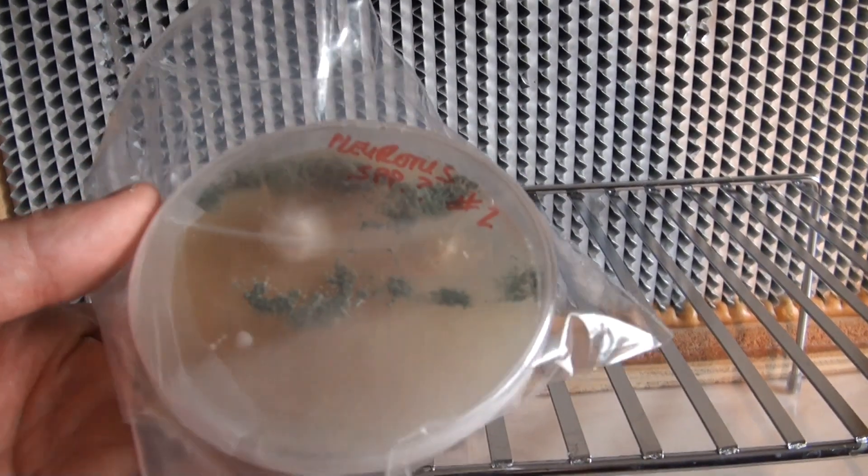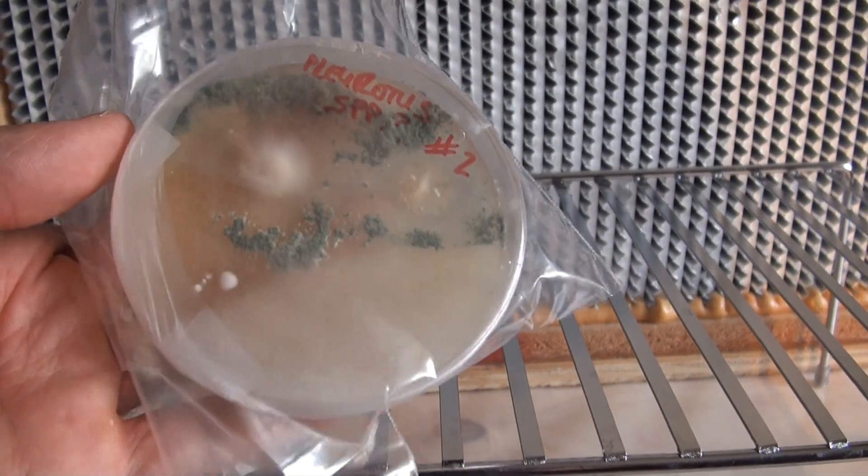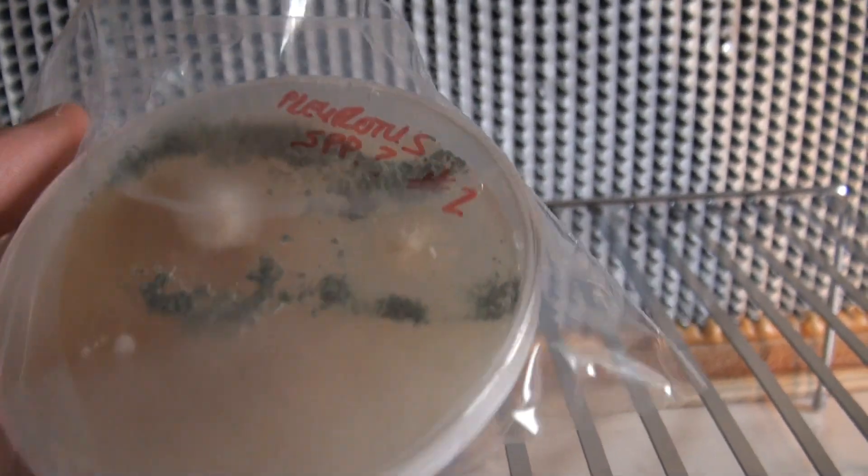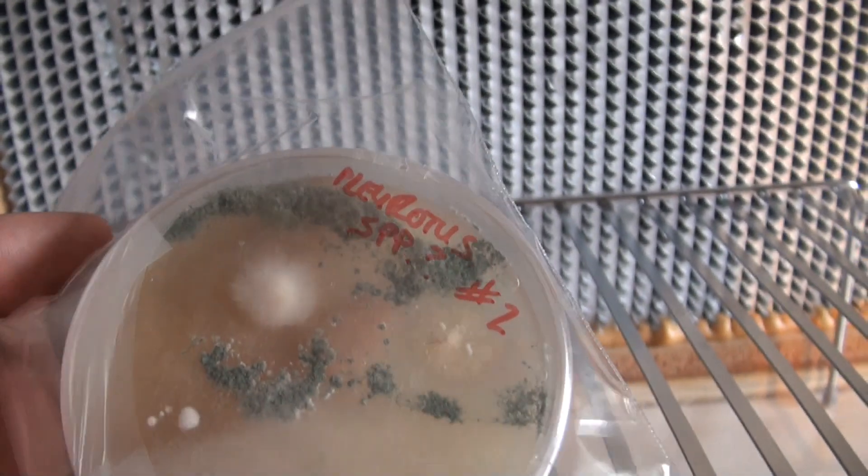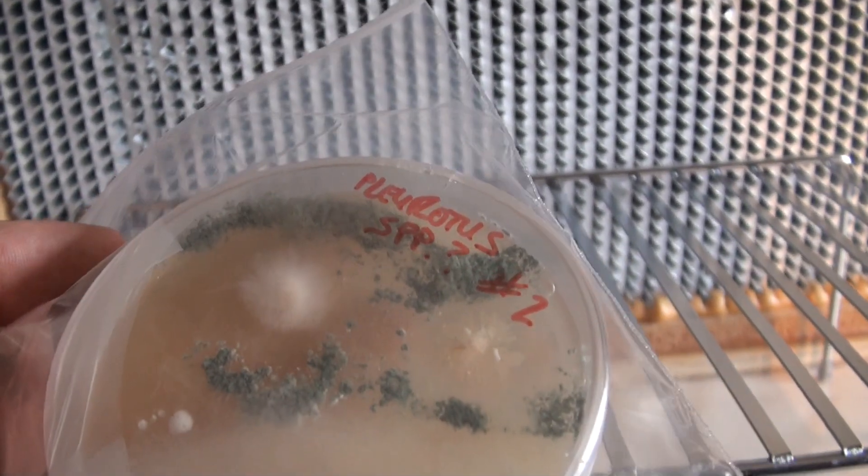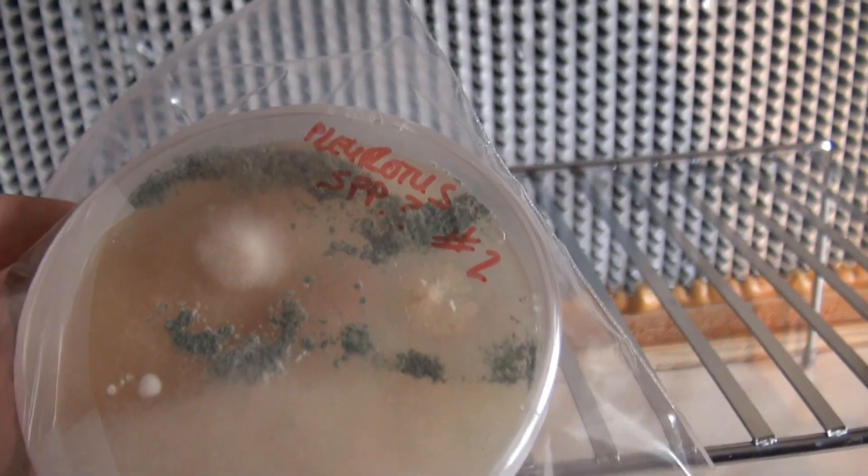Now here's one that clearly didn't go well at all. This was some kind of oyster that I was trying to clone. And there is a bunch of stuff going on in this plate and I would not even want to open this one or try and get any kind of clean mycelium off of this one. This one is just fit for the trash.